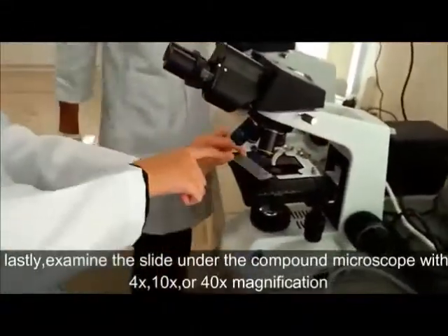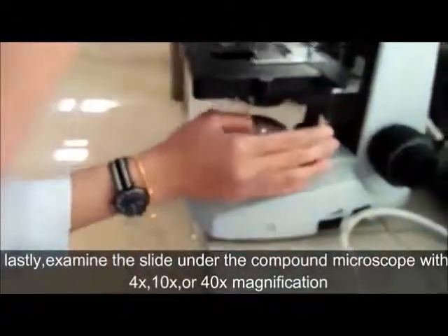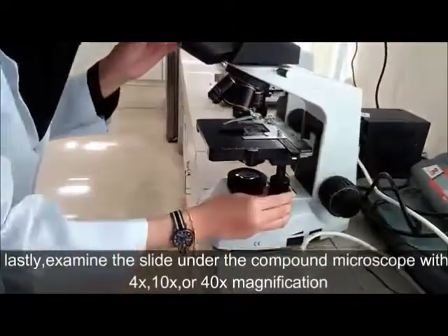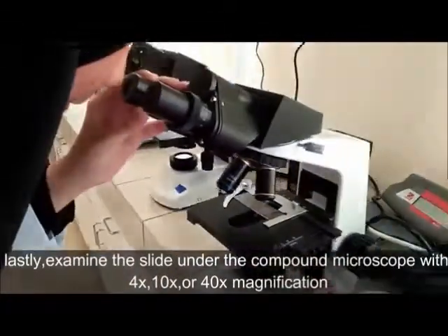Lastly, examine the slide under the compound microscope at 4 times, 10 times, or 40 times magnification.